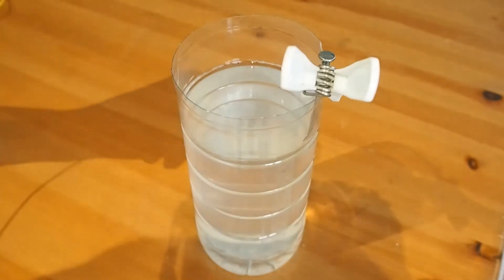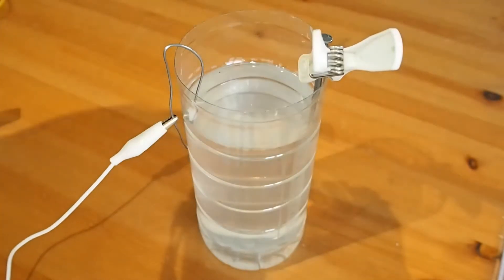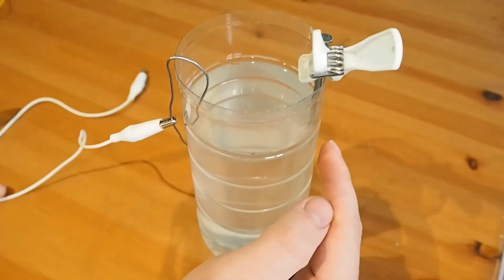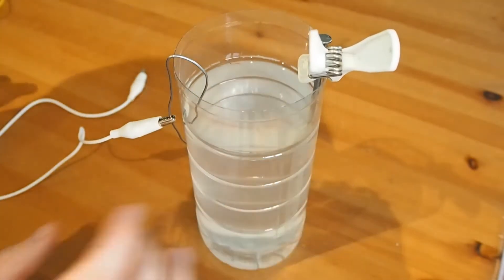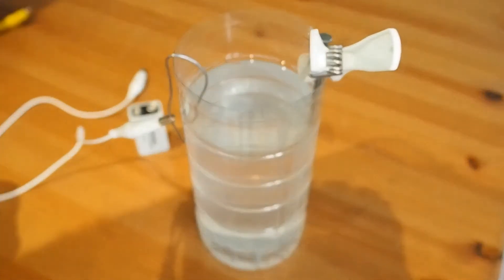So let's get these in. With the iron being our anode — and remember in an electrolytic cell, anode is positive, it's like a little battery — and cathode is negative.